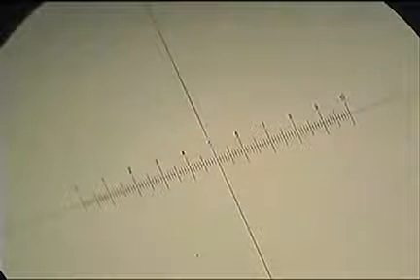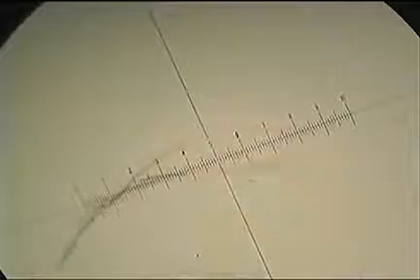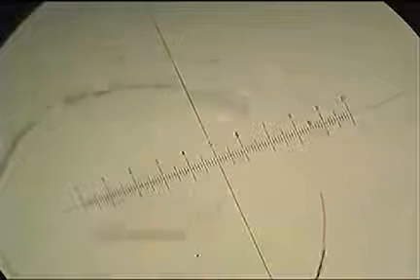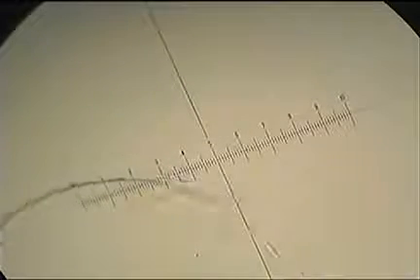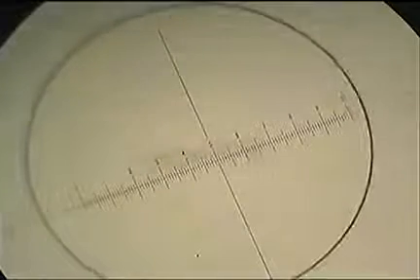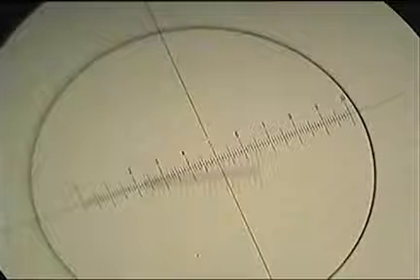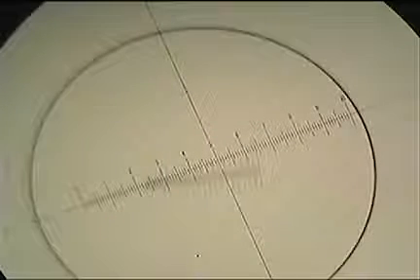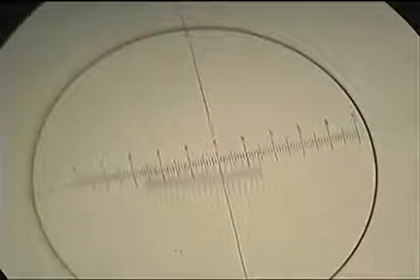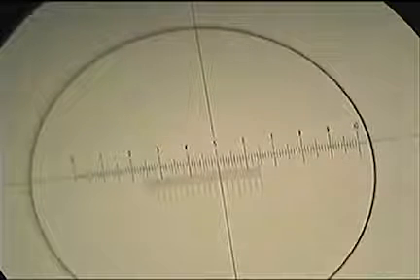So I've put a stage micrometer under the microscope, and I'm just trying to move it around to line it up. A stage micrometer is a physical slide, a piece of glass, and it basically has a very tiny ruler on it. Those are known measurements on there, and if we match them up with our eyepiece graticule, we can figure out what each unit on there actually represents. The one I'm using here is labeled 0.01 millimeters. That's the smallest unit, and at the moment they're quite fuzzy.